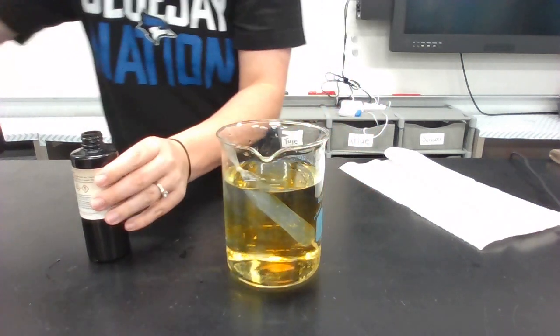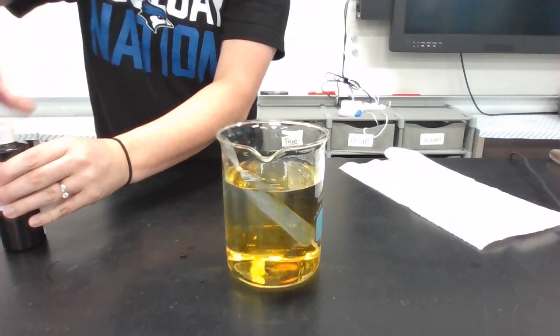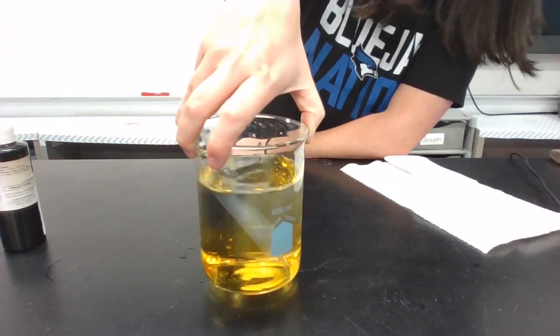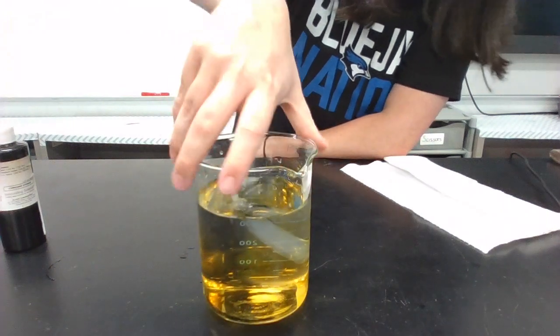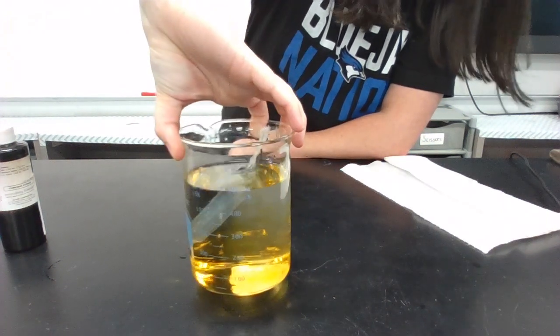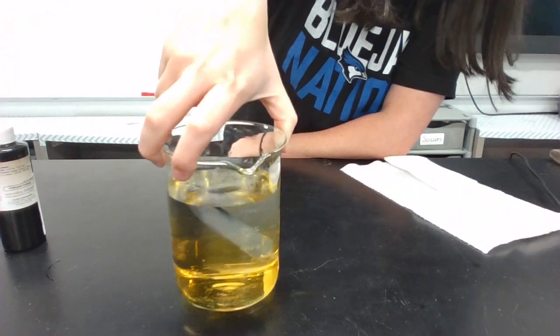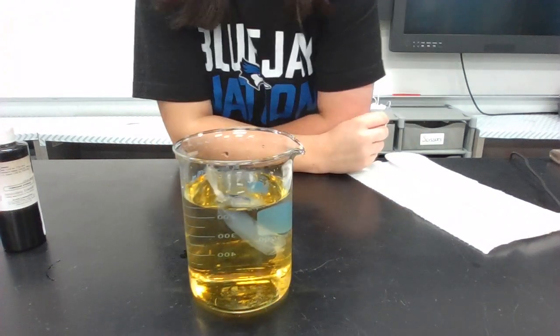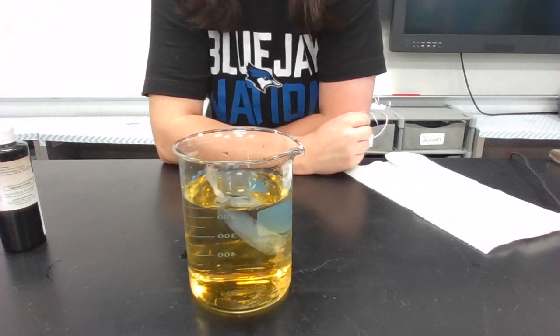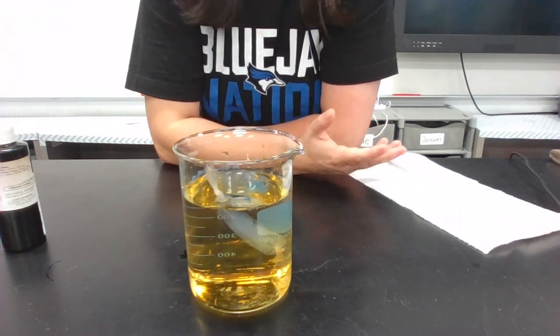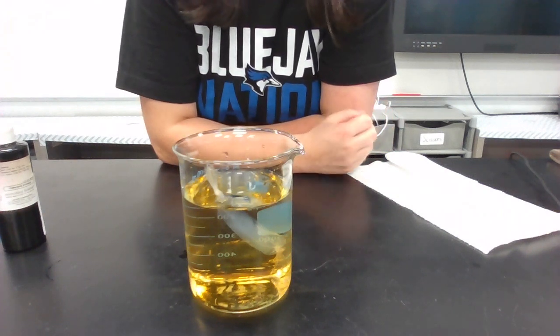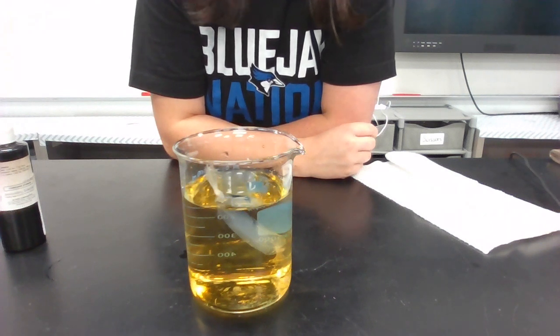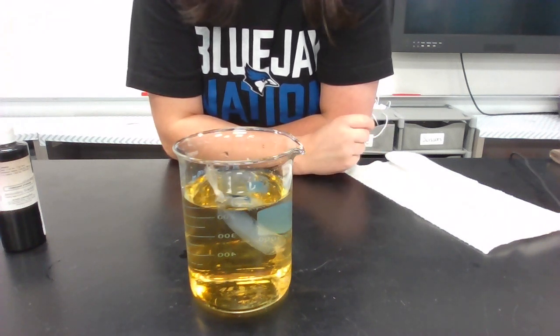Okay, I did 20. And the reason I picked 20 is just because it looks like that has really filled up the whole container. So you can see that the iodine solution has just diffused all throughout that water. And now instead of being clear, the water is sort of orangish, which is the color of iodine. So that is all I'm doing for my setup. I'm going to let this sit for 24 hours and then we will come back tomorrow and we will check out our results.